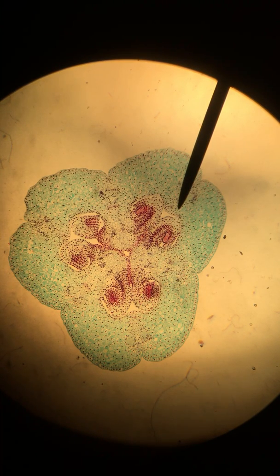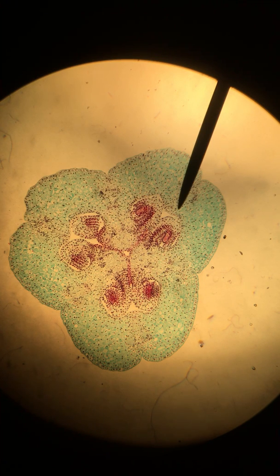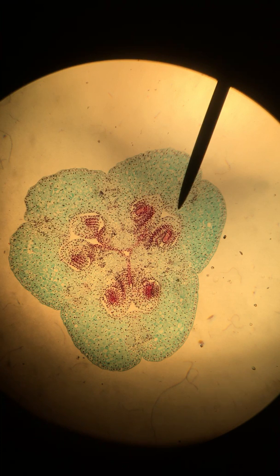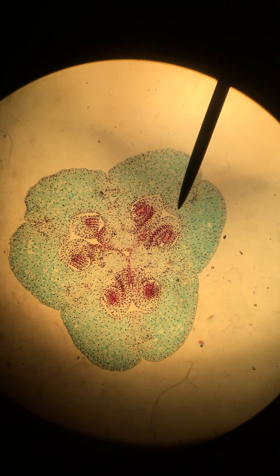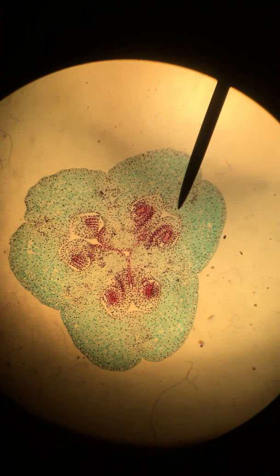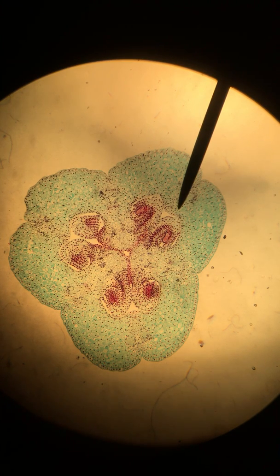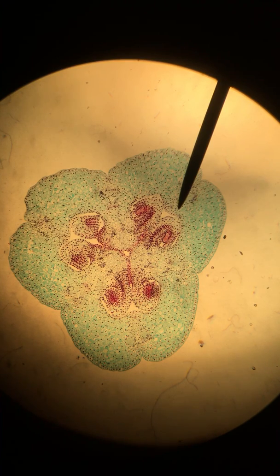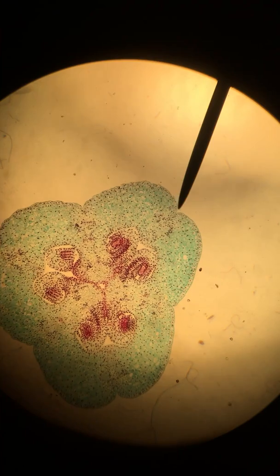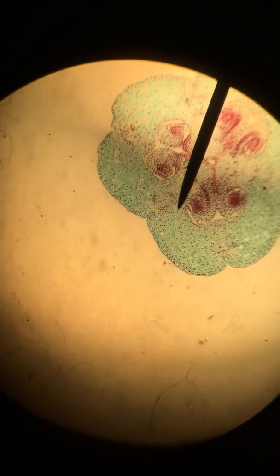This is slide 6: ovule with megasporocyte slash megaspore mother cell. In this slide we are looking for the megasporangium, megasporocyte, ovule, placenta, and ovary wall. This entire structure here is a cross section through the ovary.